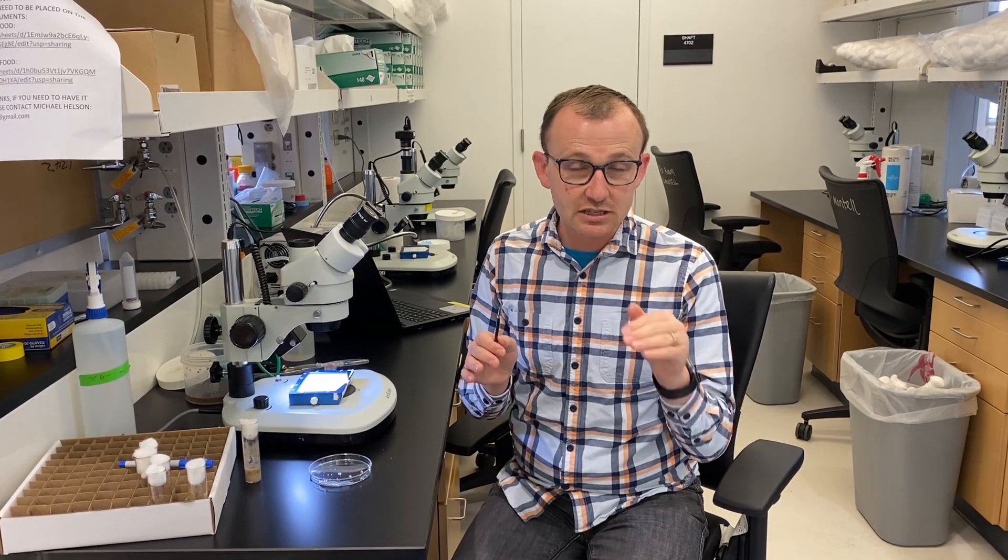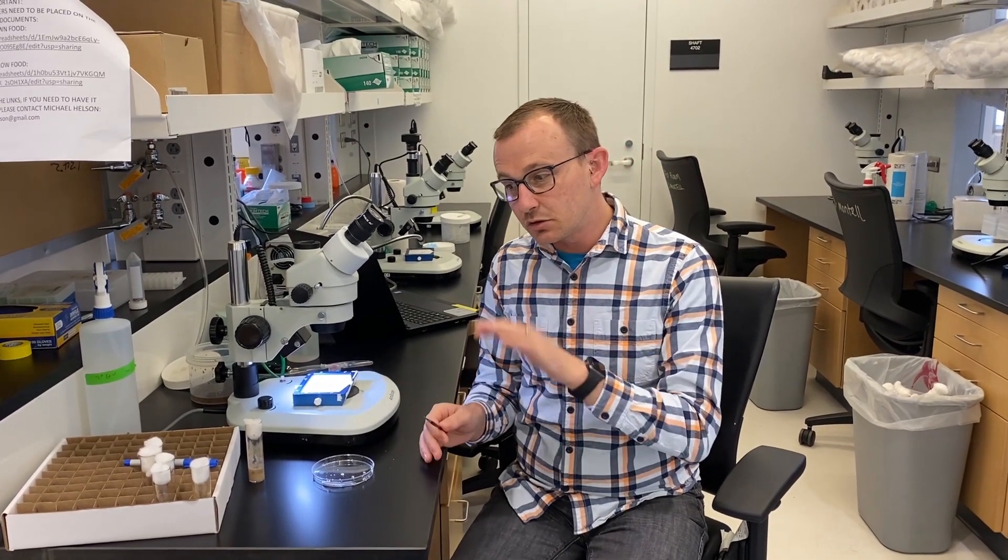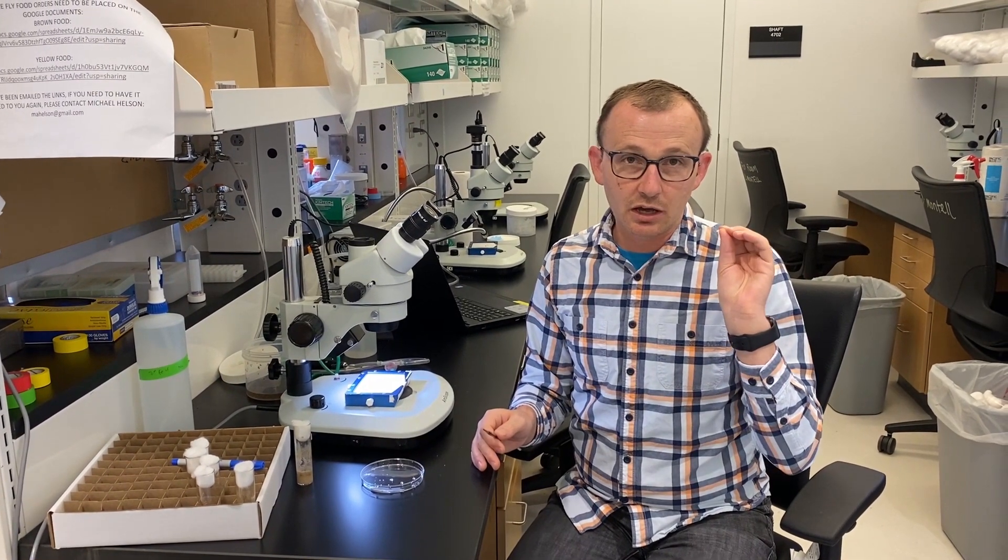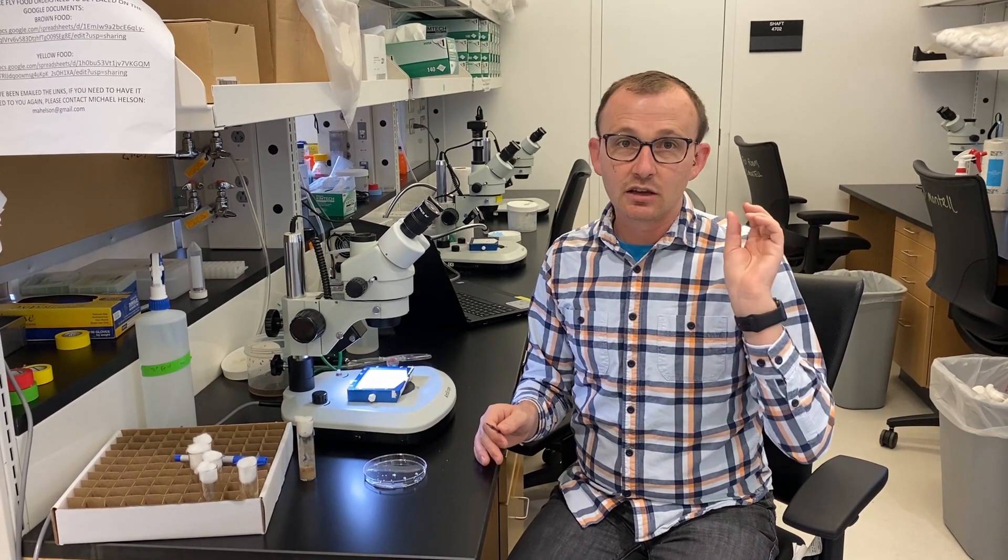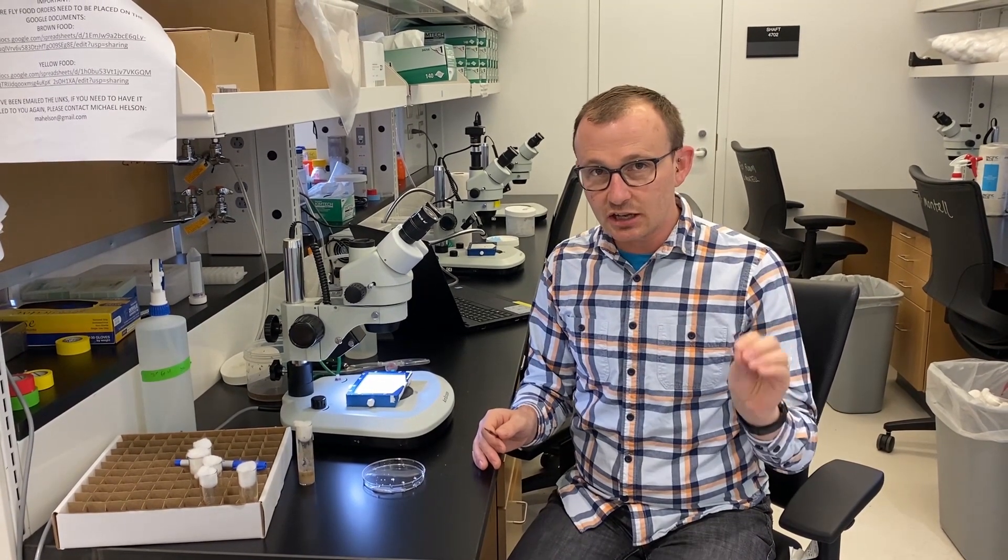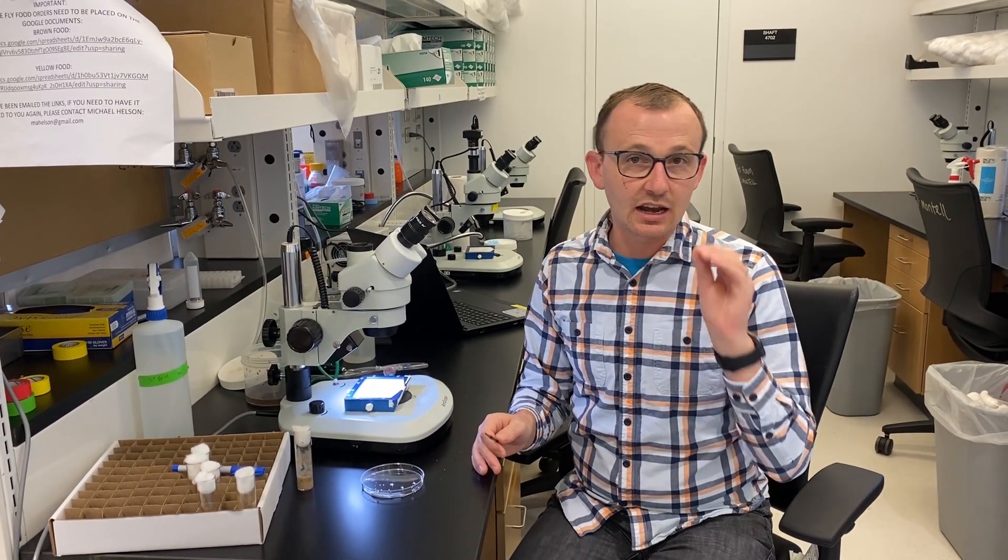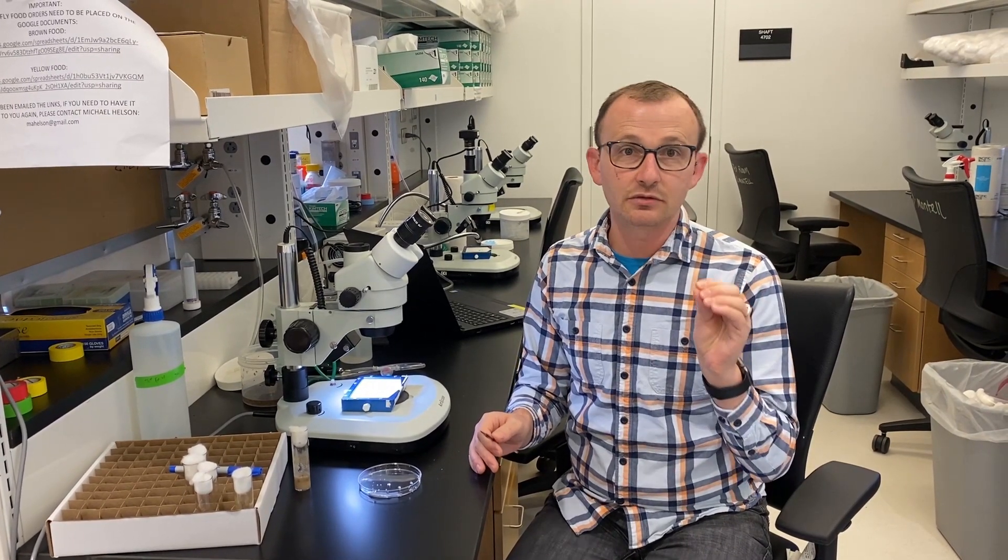And now in the time of COVID, as we have limited time in the lab, this is a beautiful way, especially if you keep your animals at 18 or your pupae at 18, to be able to maintain a steady stream of virgin collection without missing very much. So I can usually do this once a day and I collect nearly every single virgin that is available.